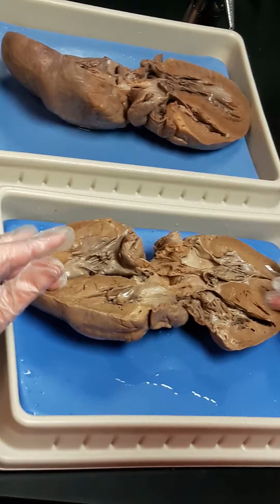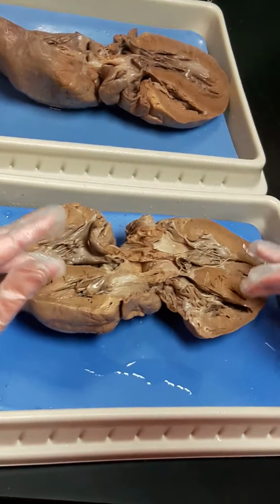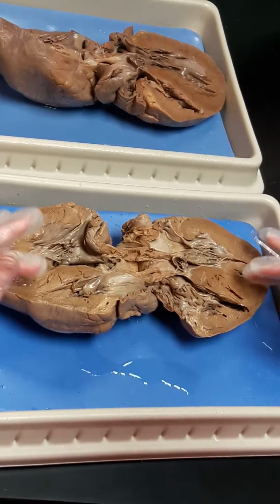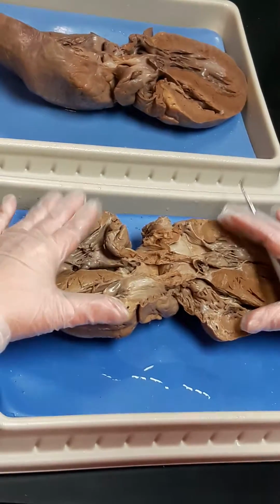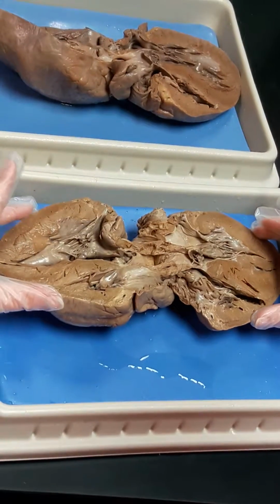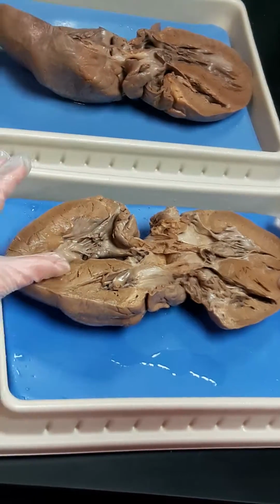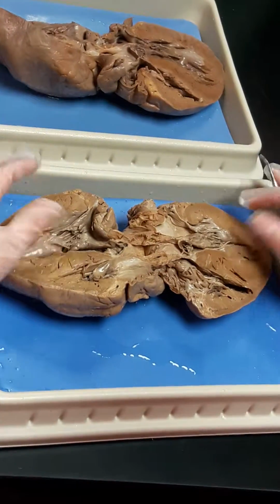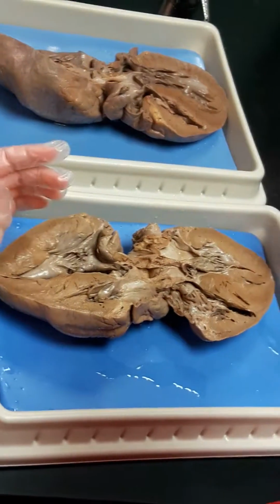So the interventricular septum is the wall that separates the left and the right ventricles. The name breaks down to "between ventricles." Septum means wall, just like your nasal septum. And then myocardium is all of the heart muscle. I would pin it on the outside and not in the interventricular septum, okay? But if you're not sure, you're welcome to say, hey, do you mean just this wall? Do you mean all of it? Make sure you word your questions carefully.